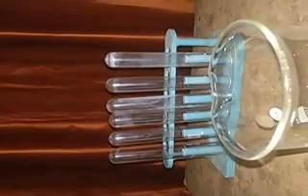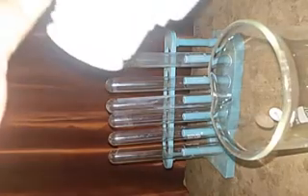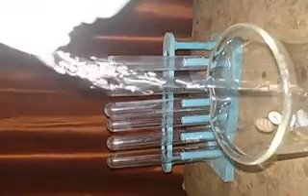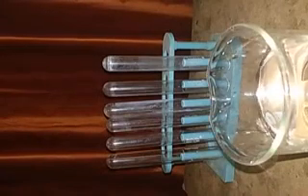Now from the distilled water, we are going to take some distilled water for our experiment. Let us take the distilled water out into the beaker. This is the distilled water in the beaker.